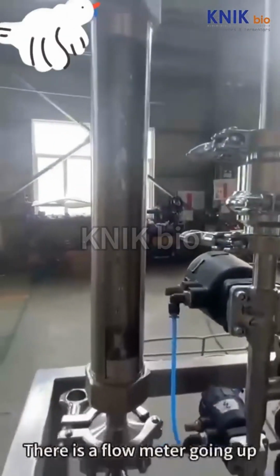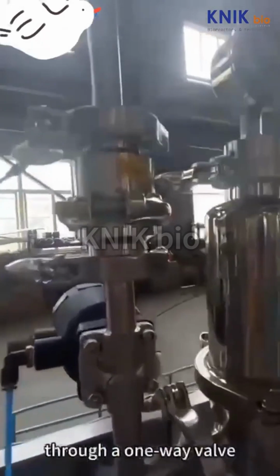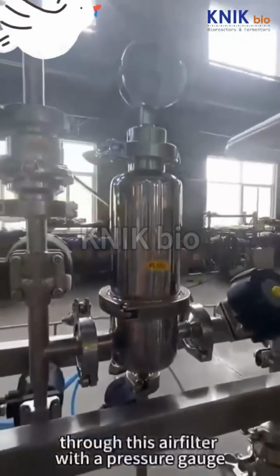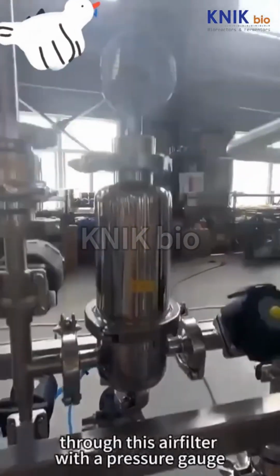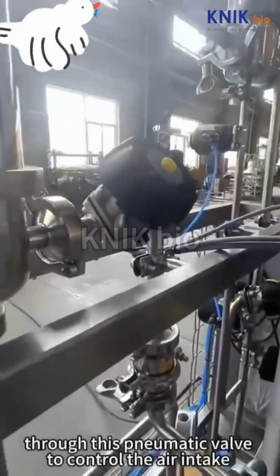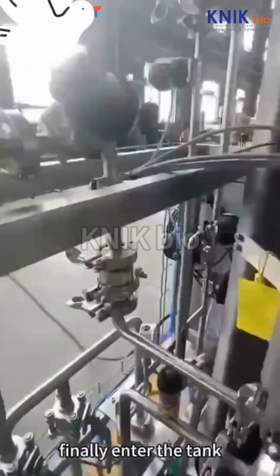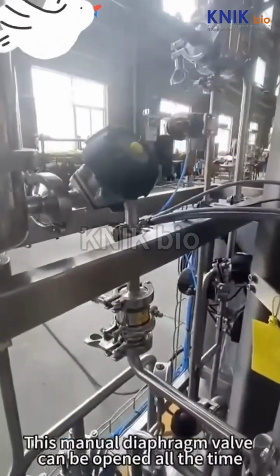There is a flow meter going up through a one-way valve. Through this pneumatic valve to control the air intake. Through this air filter with a pressure gauge. Through this pneumatic valve to control the air intake. After that is a one-way valve. Finally, enter the tank. This manual diaphragm valve can be opened all the time.